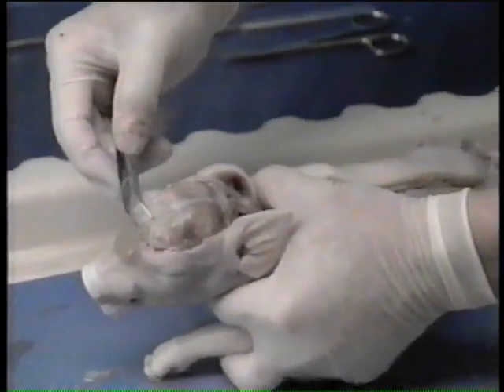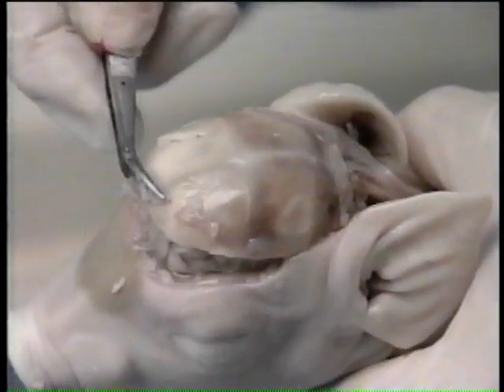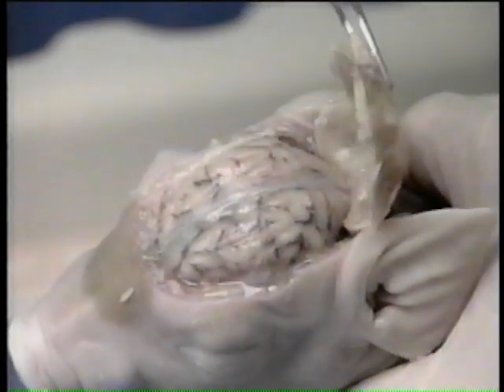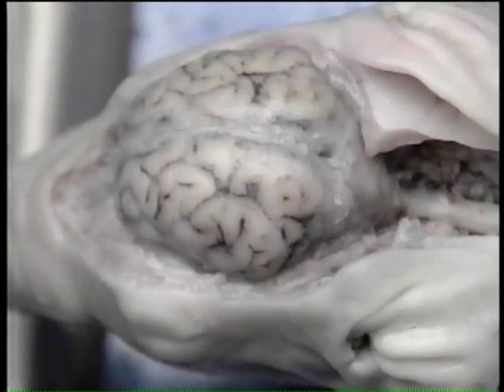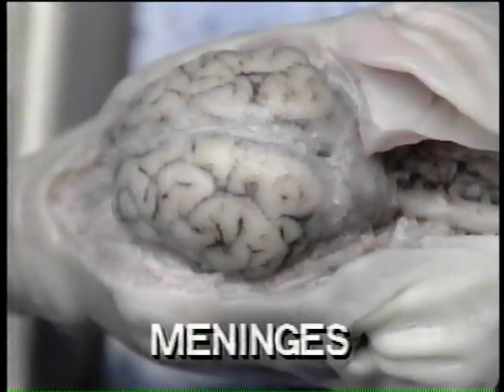Now, using forceps, gently lift the cut section of skull. After removing the top of the skull, you'll find a membrane called the meninges. Remove it carefully.